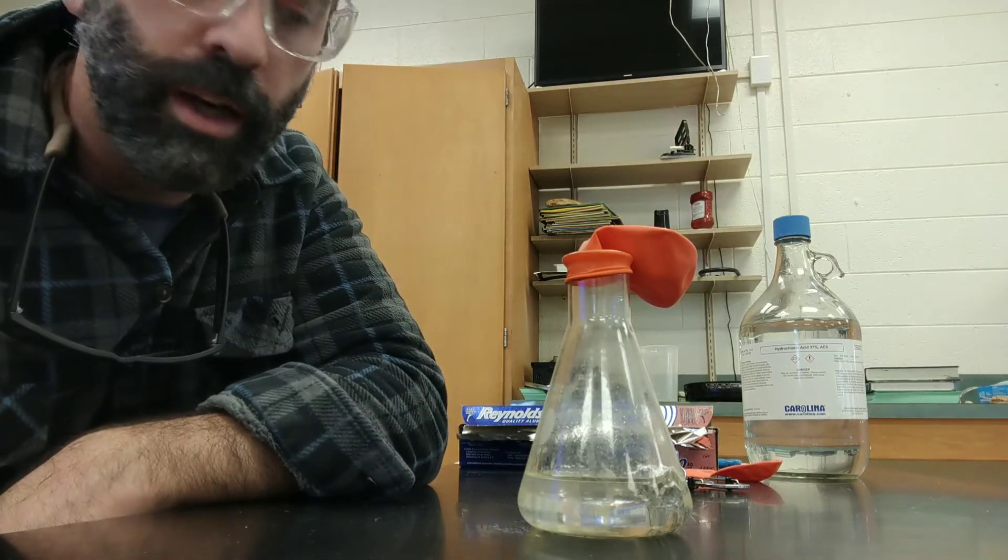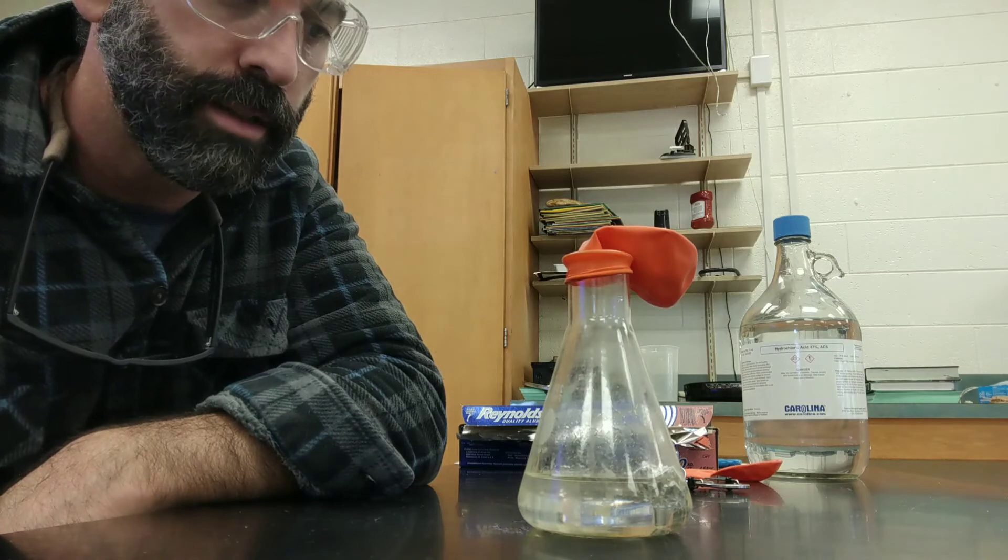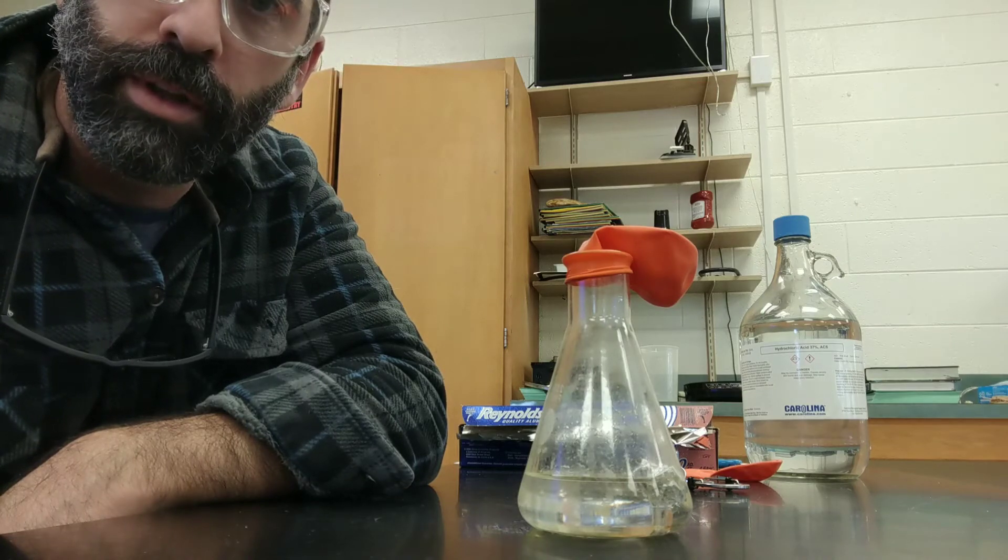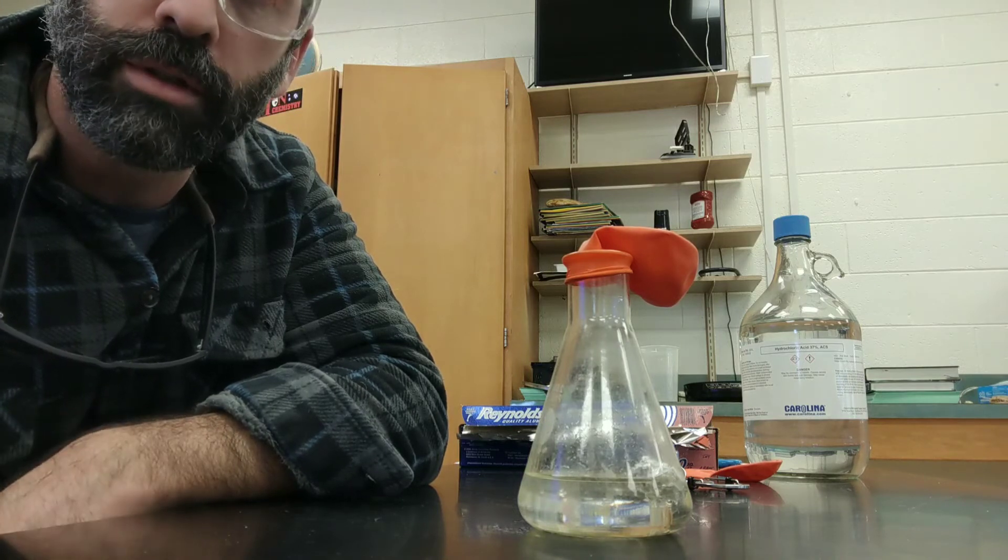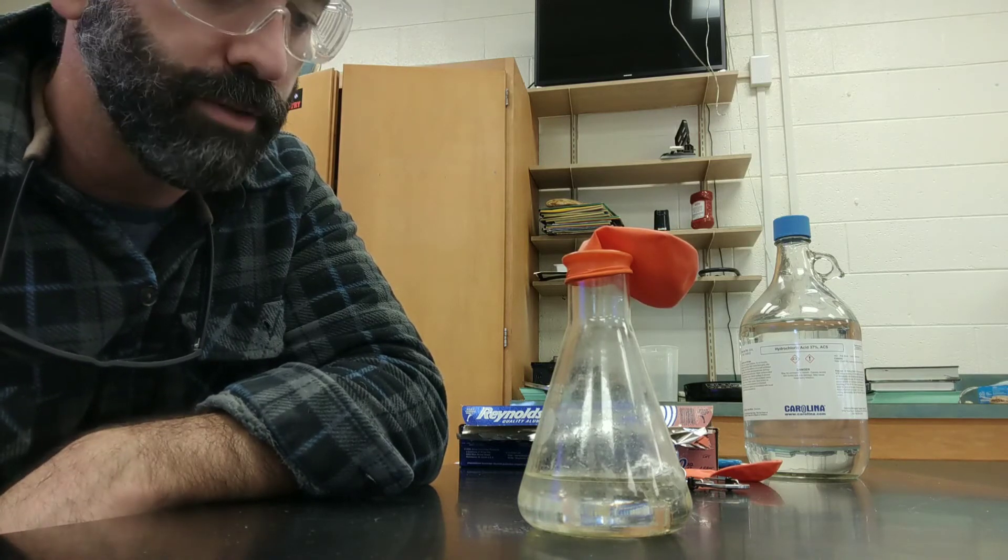It might be a good idea to wear some gloves. Hydrochloric acid is not something you want to mess around with, and definitely wear your safety goggles. If you get it on your clothes, you want to take those clothes off right away.